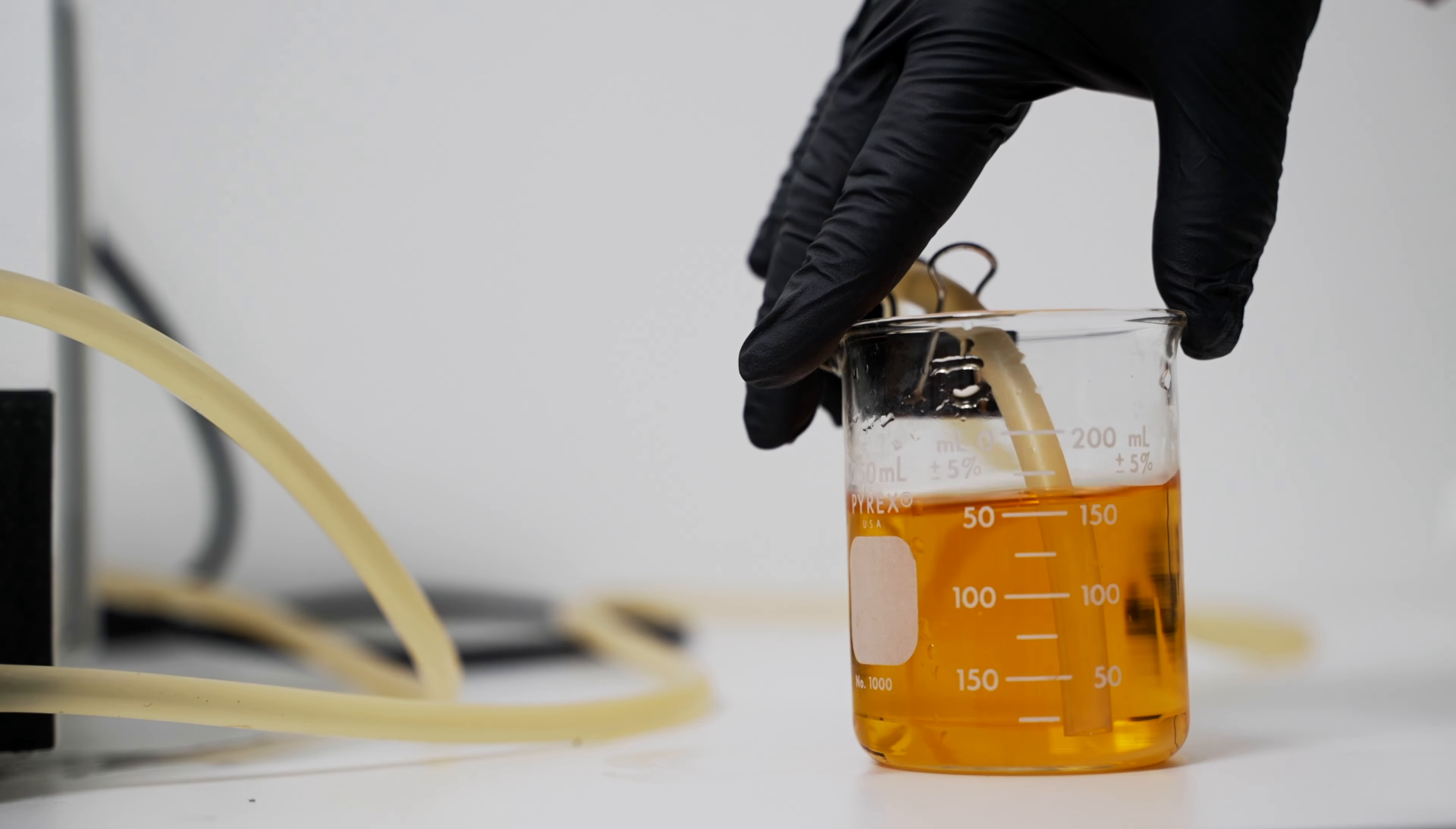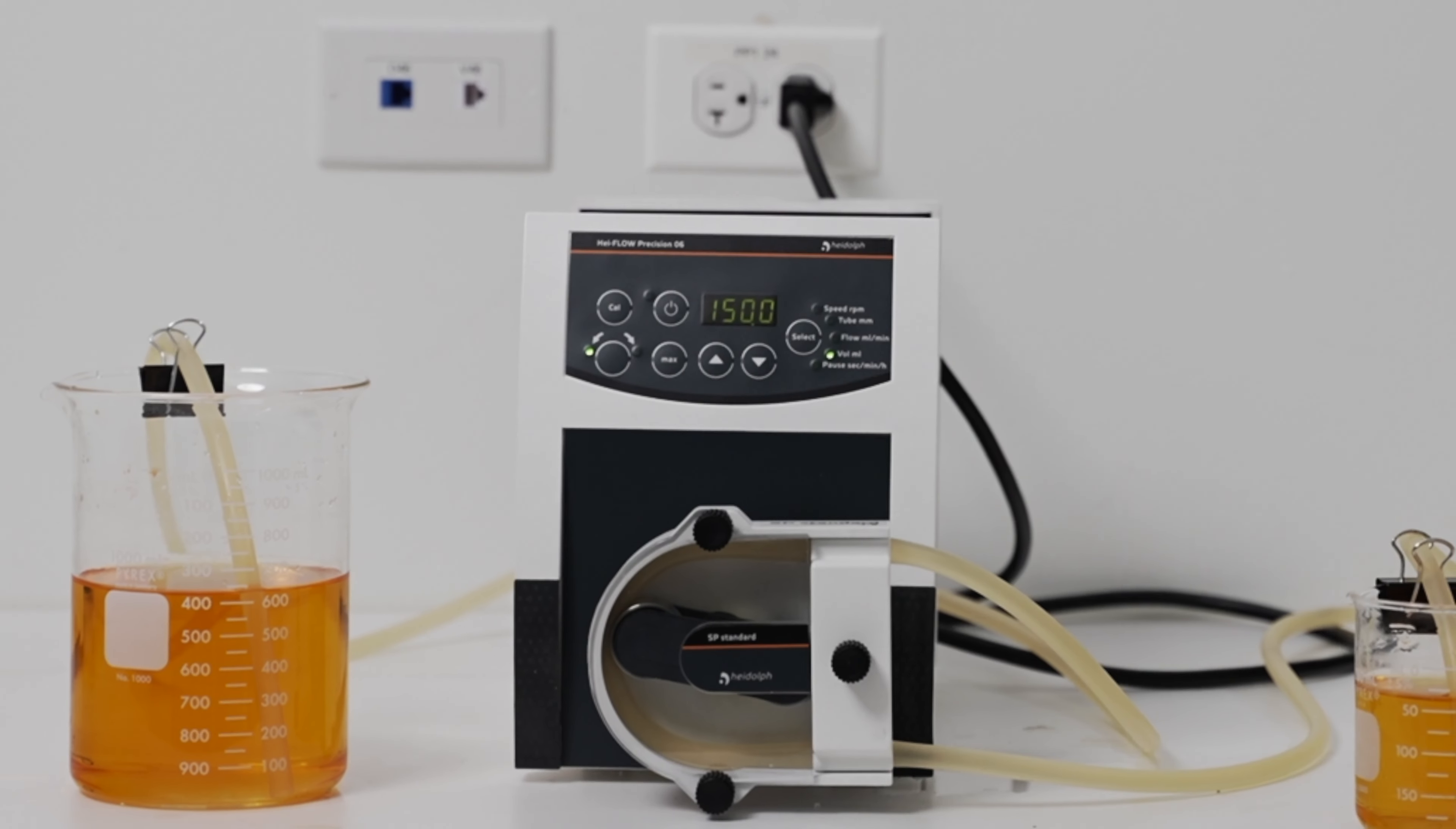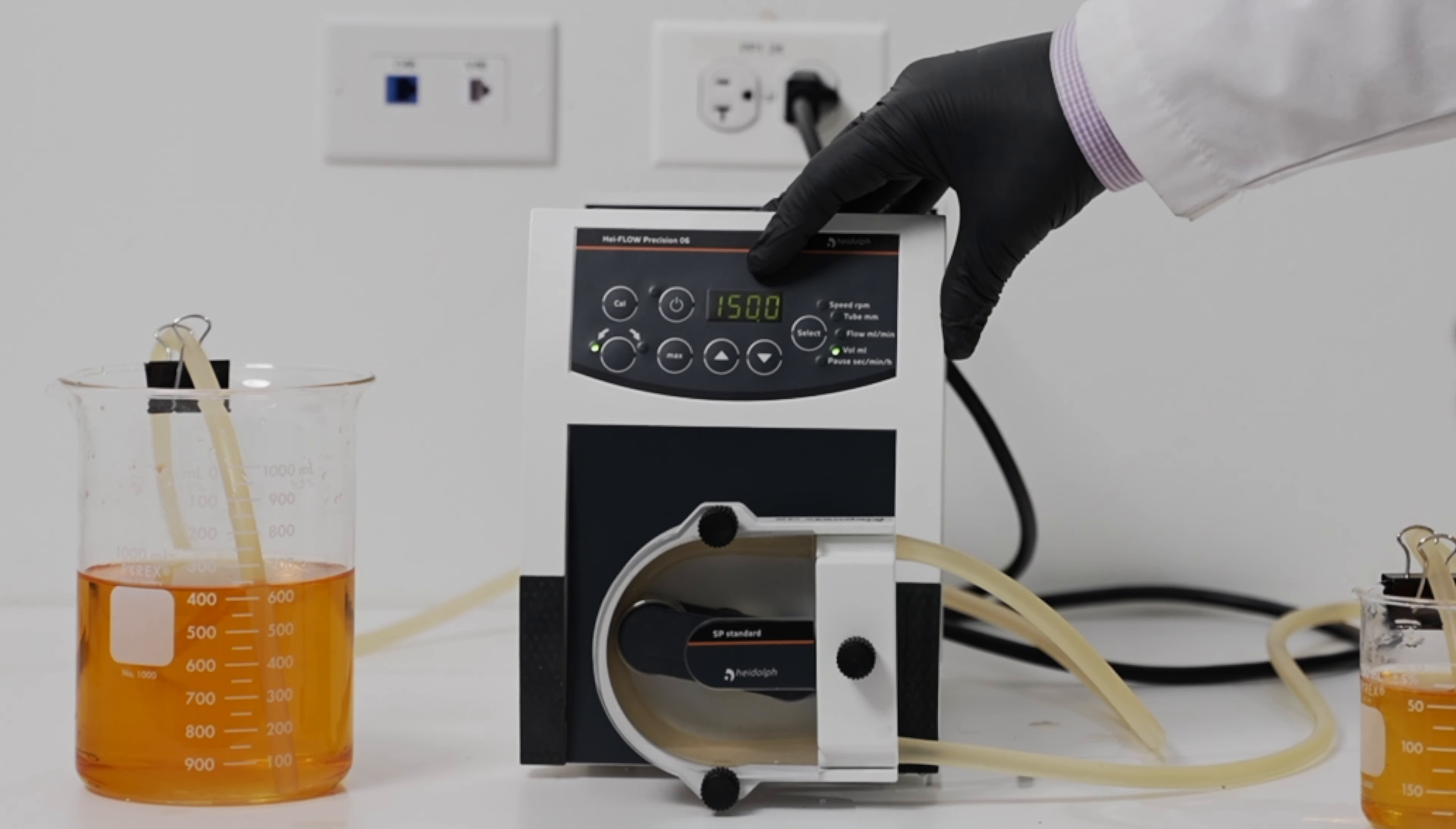And as you can see, we're a bit above 150, pretty close to the 175 mark. As we saw, since that volume was not 150, we're going to want to calibrate it so that it can dose more accurately.